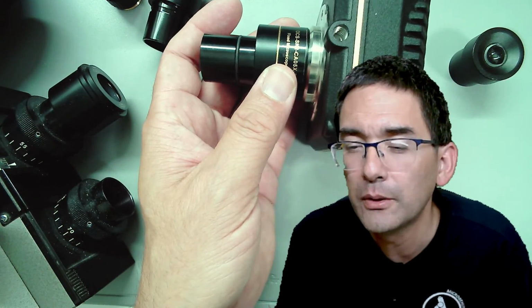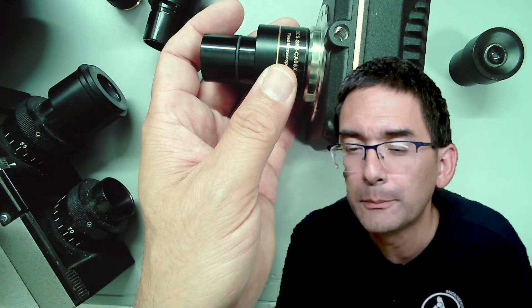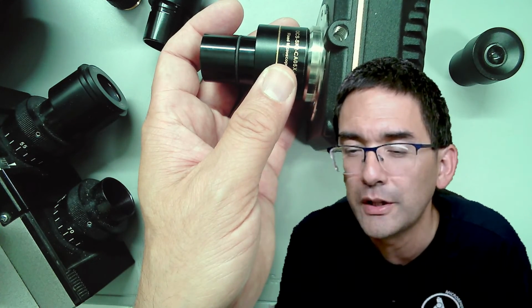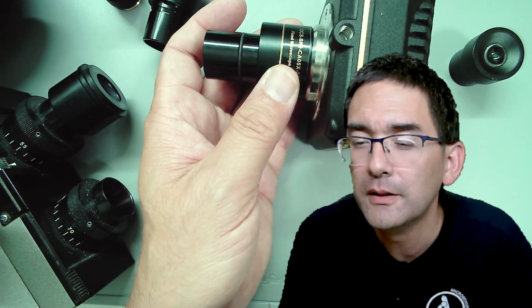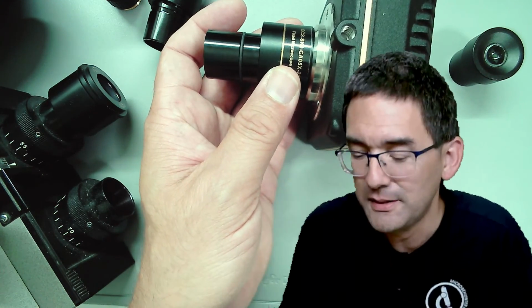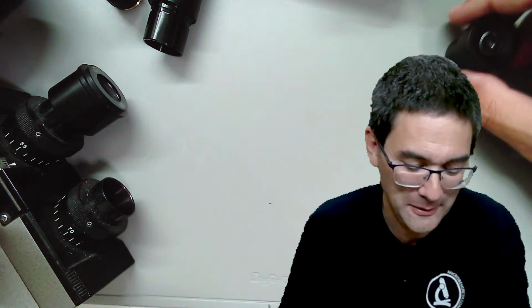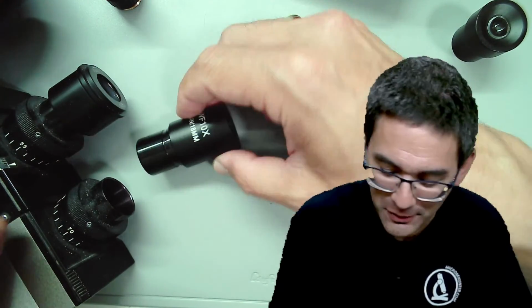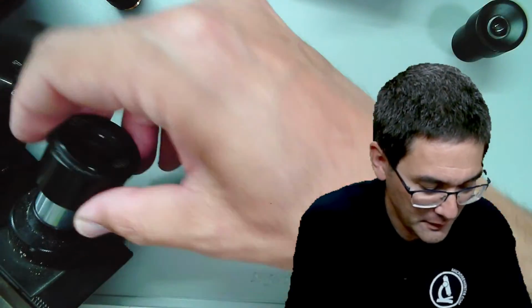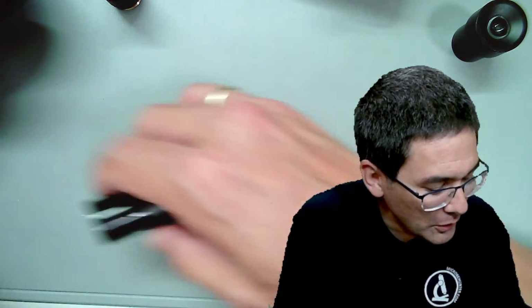I have a Canon camera attached to the trinocular photo tube, but the problem is I'm getting a lot of chromatic aberration with purple fringing. Yep, I can talk about that. There is no chromatic aberration looking through the eyepieces. Okay, I'll talk about this when I talk about the next system here, chromatic aberration, because this is an issue as well.